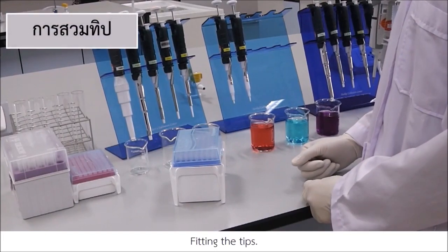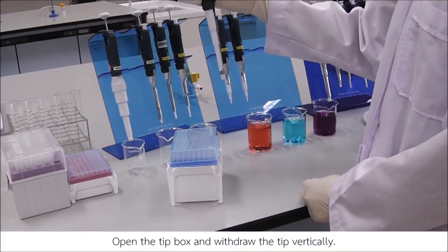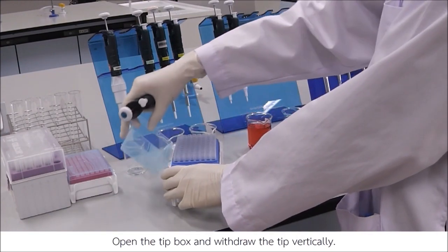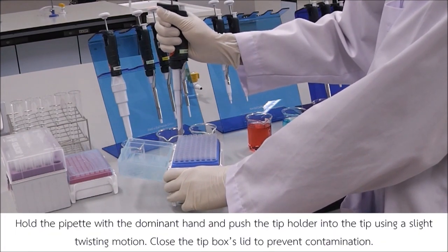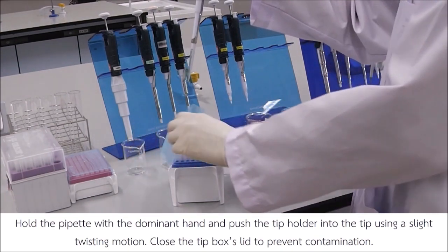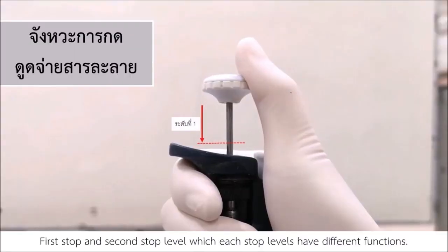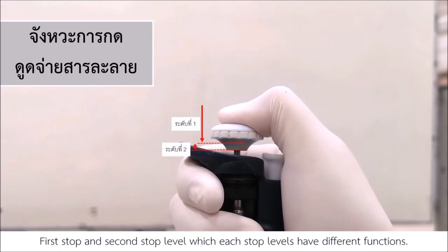Fitting the tips. Open the tip box and withdraw the tip vertically. Hold the pipette with the dominant hand and push the tip holder into the tip using a slight twisting motion. Close the tip box's lid to prevent contamination. Pipetting motion. There are 2-step levels of pipetting. First stop and second stop level, which each stop levels have different functions.